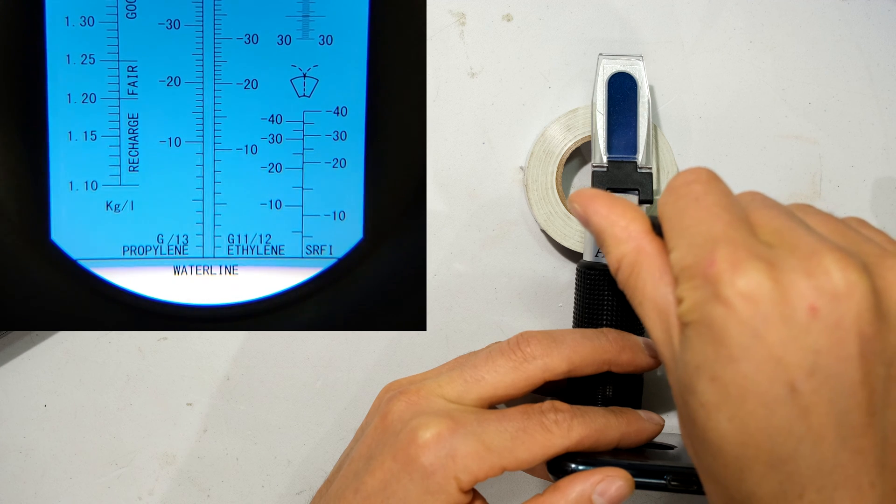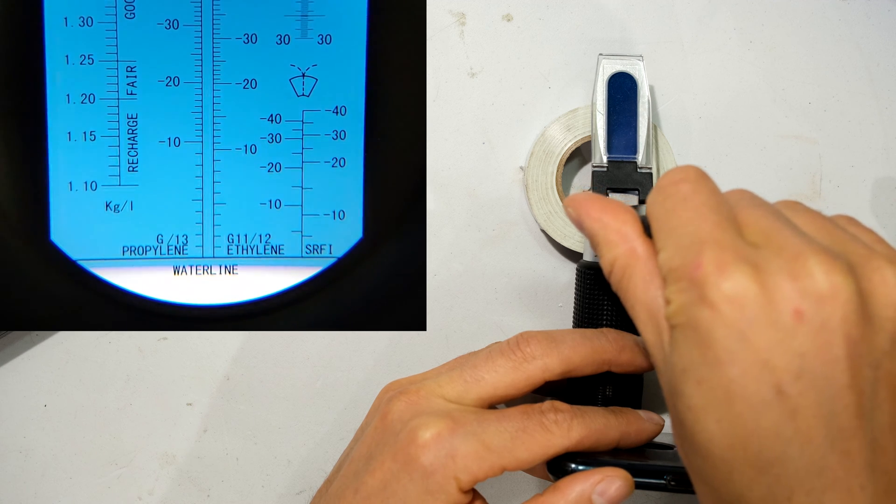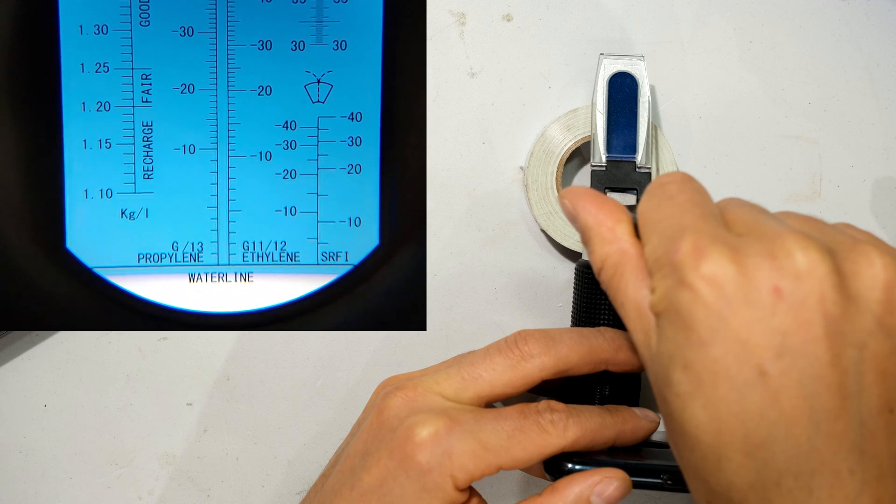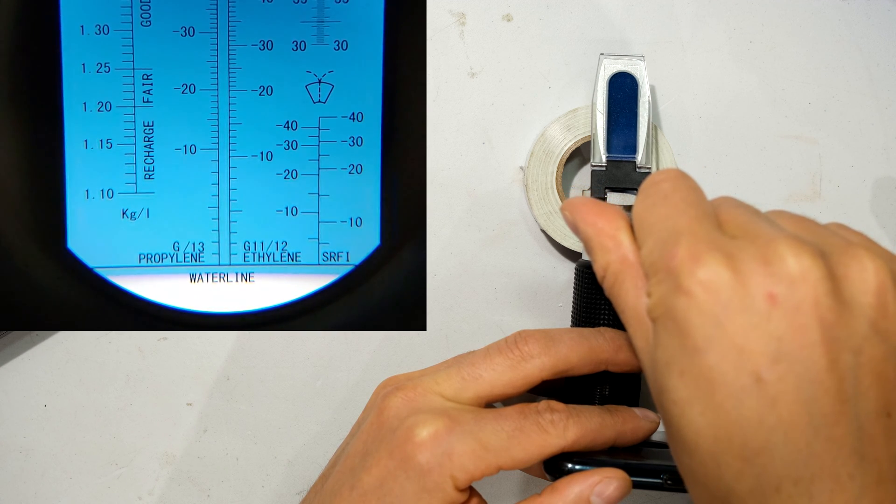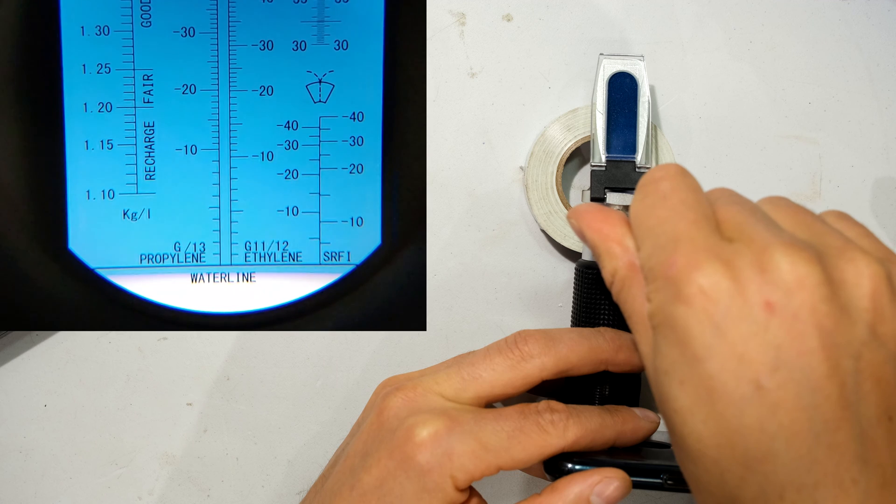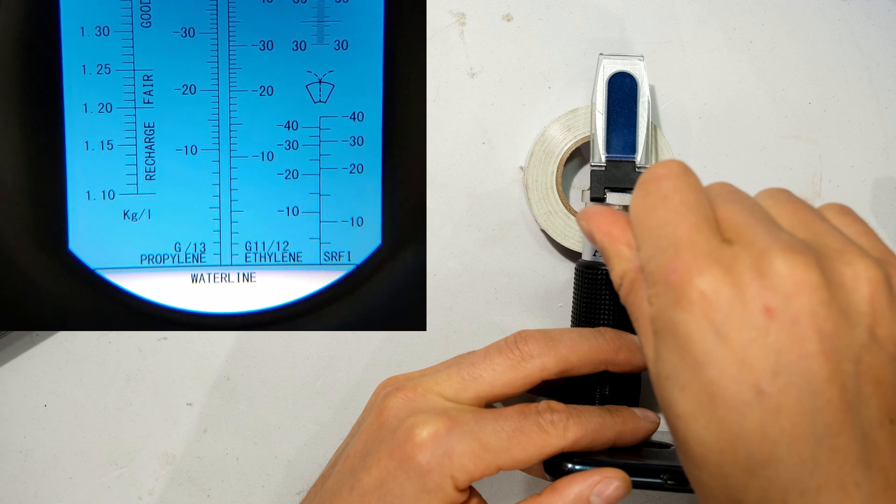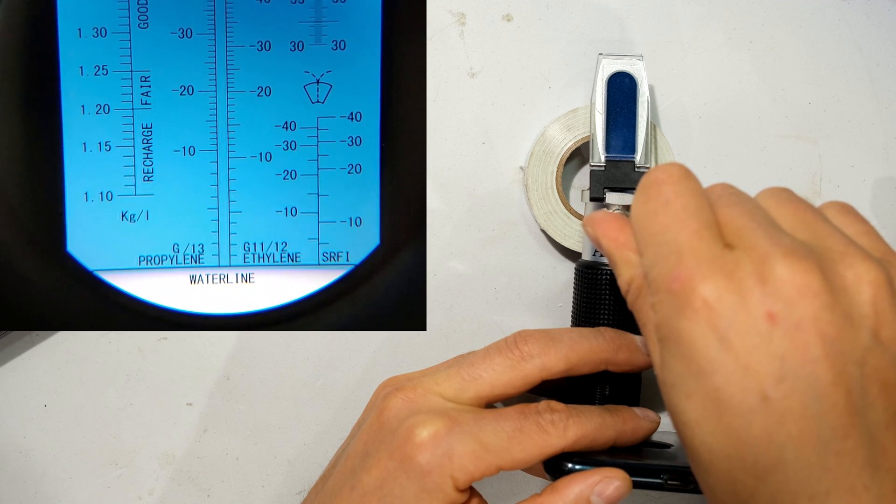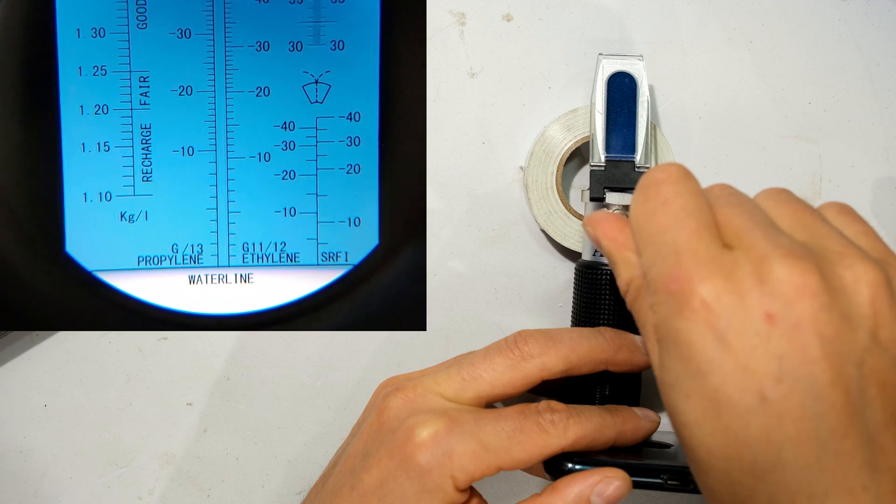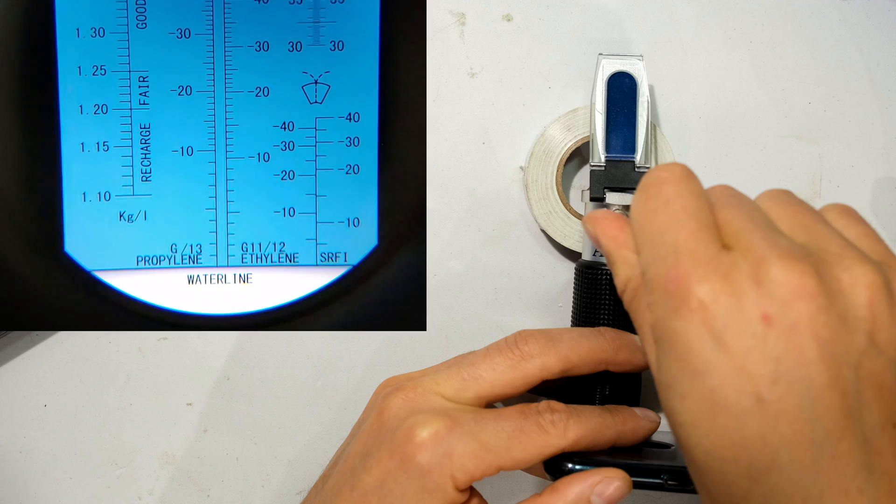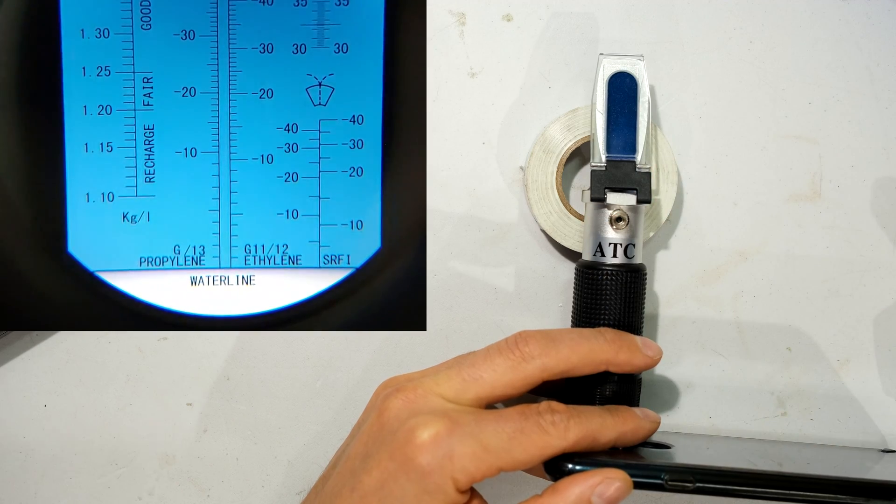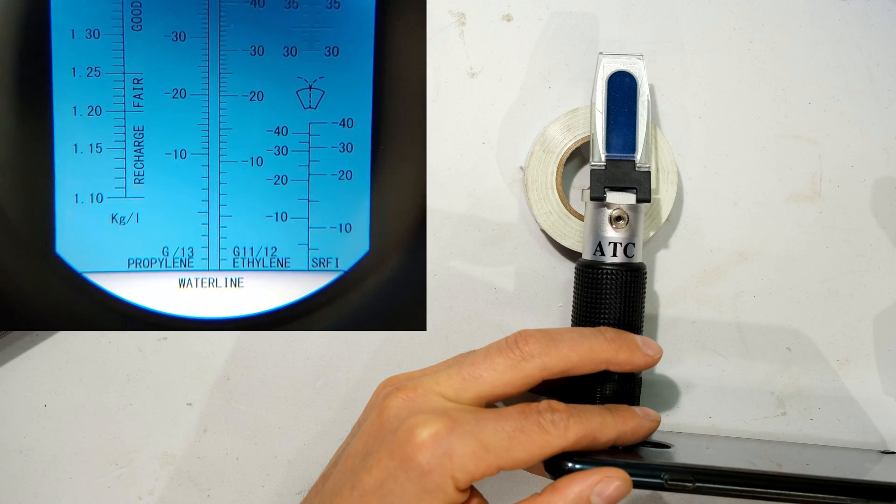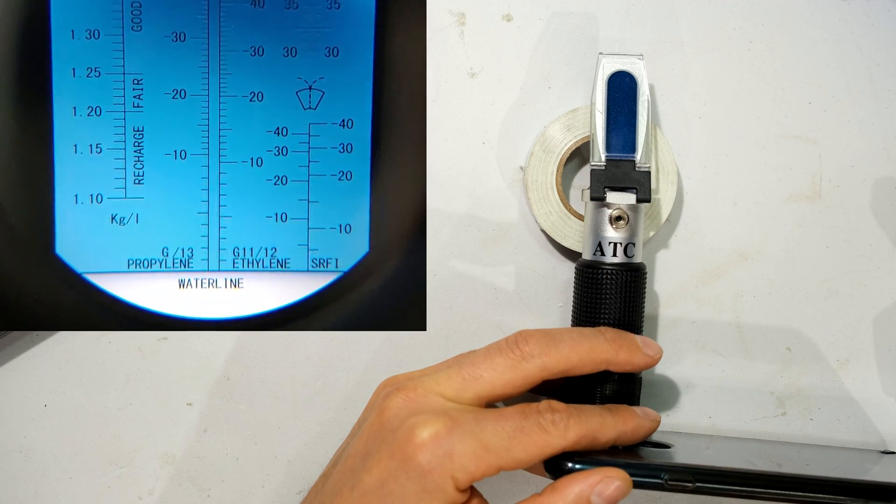Right, so there I've overshot. Right, so that's clockwise and I've overshot a bit. Now I'm going anti-clockwise just to calibrate. Right, so that is about right. You can see the shading and the water line is now in the same place.